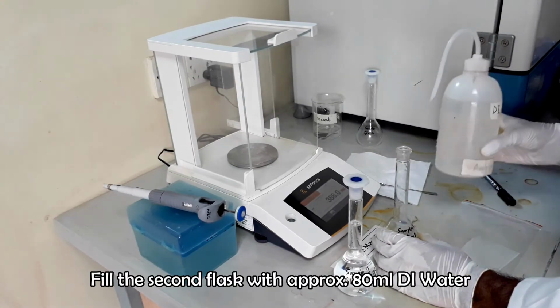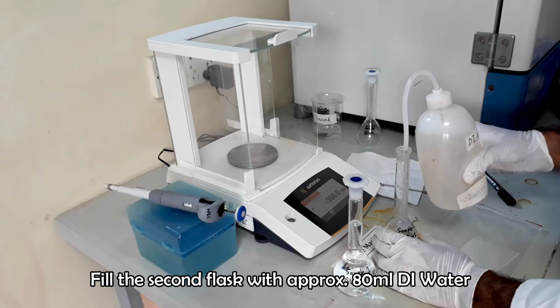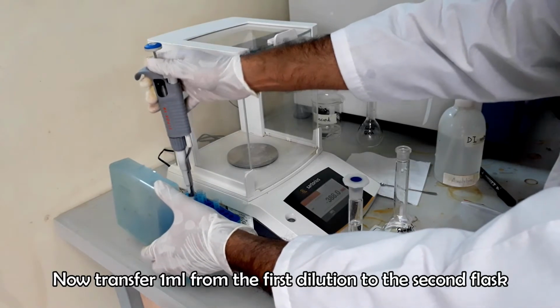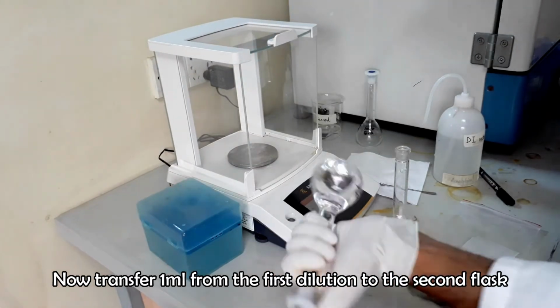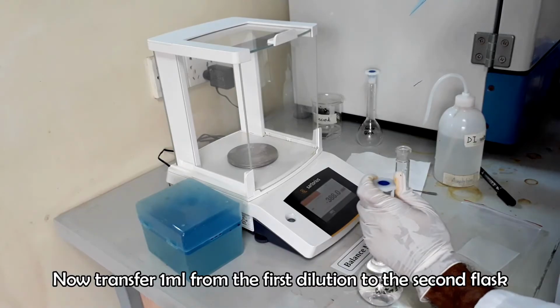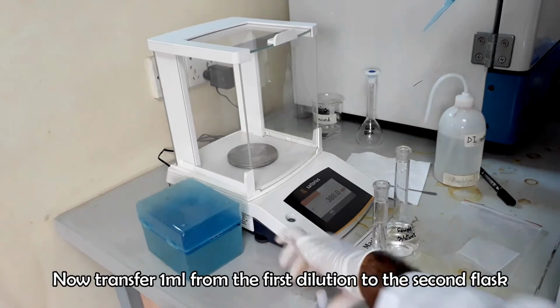Now take approximately 80 ml of deionized water into the second flask and add 1 milliliter sample solution from the first dilution flask by micropipette.